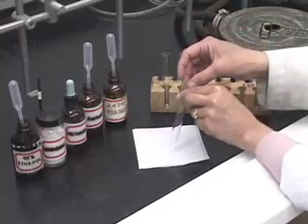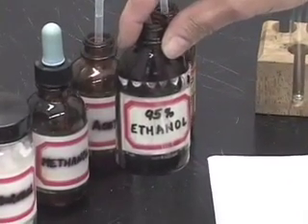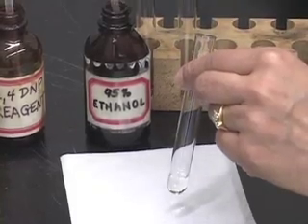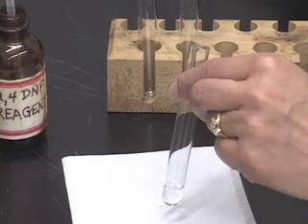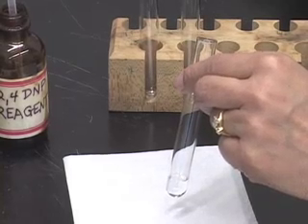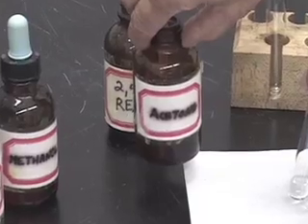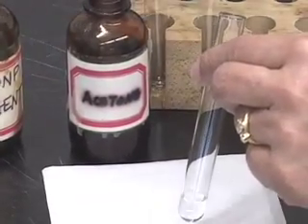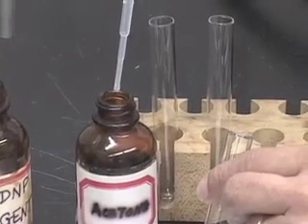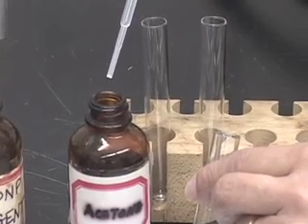First, take 1 milliliter of 95% ethanol in a test tube. Then add 5 drops of the test compound if it is a liquid, or a spatula tip full if it is a solid. I am going to first test acetone, which is a liquid and a ketone, as the name ending in -one indicates. So I am adding 5 drops of acetone to the test tube containing 1 ml of 95% ethanol.